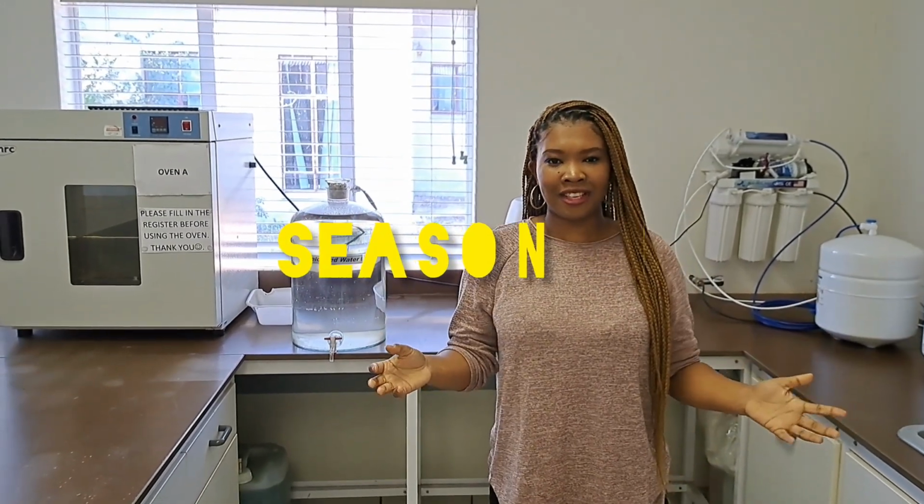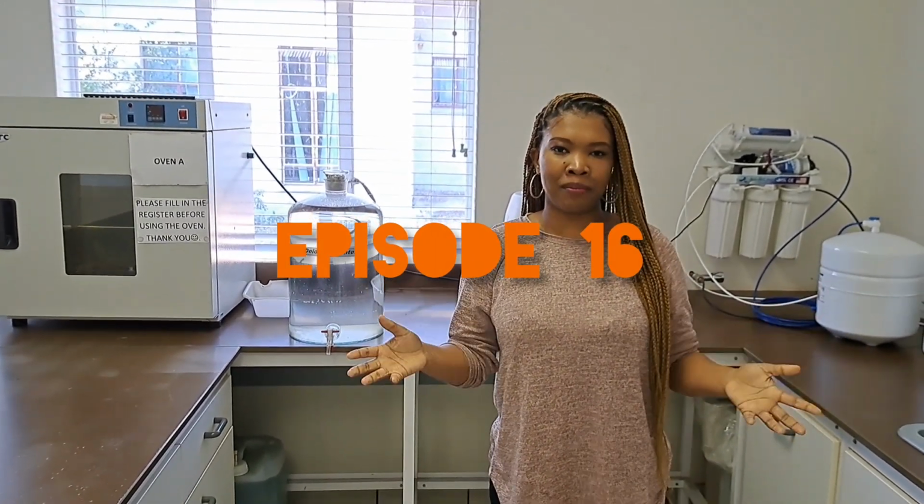This is our science research laboratory. This is one of three parts. So this is our preparation lab. This is where your scientists will come from the field, bring their samples here to prepare, whether it's their water samples, your grass, your soil samples.